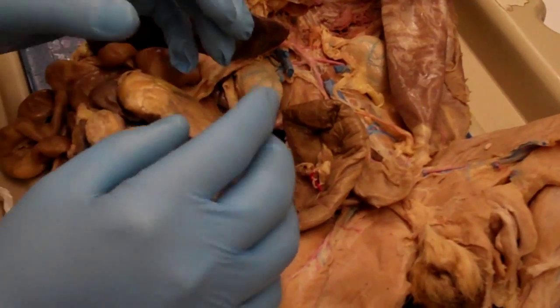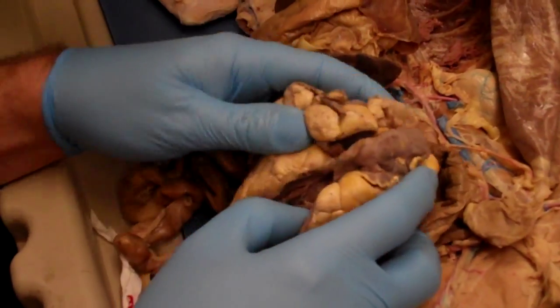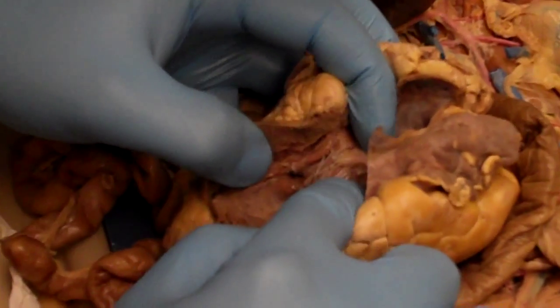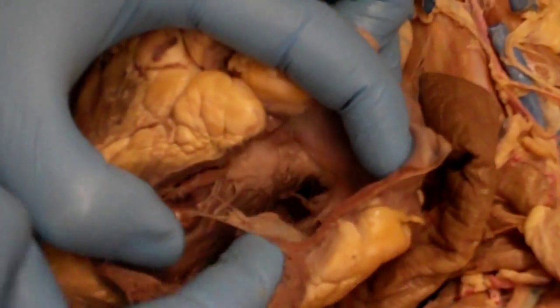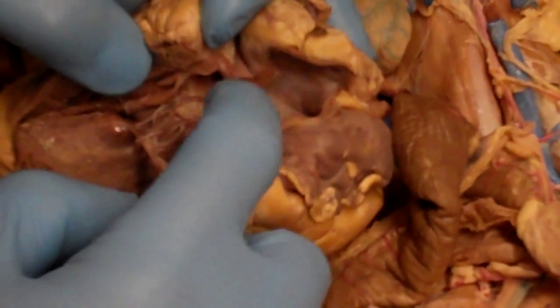And then the tricuspid valve is the right AV valve. Yep, it's just another name for the right AV valve. So if we open up the right atrium and the right ventricle, it's hard because there are these sail-like, almost cloth-like structures. You can see some of it right there. Some of it's right there. They're really just flaps between the atrium and the ventricles.